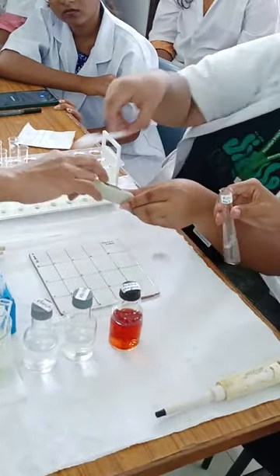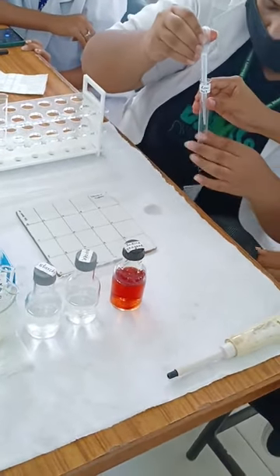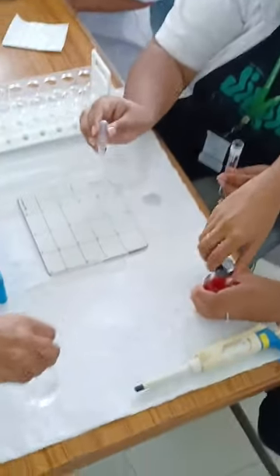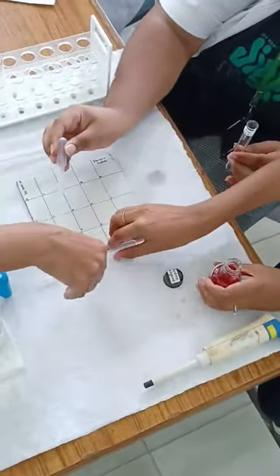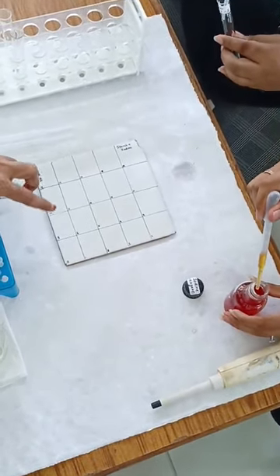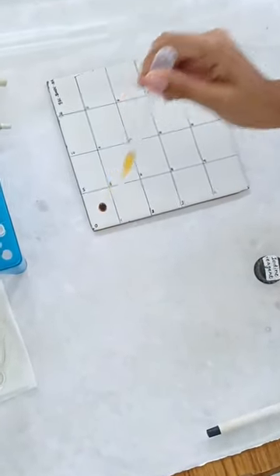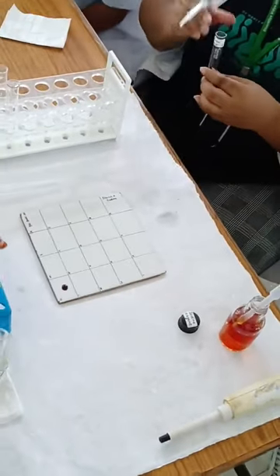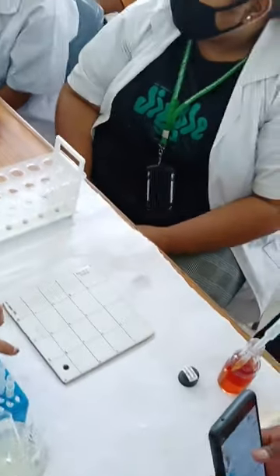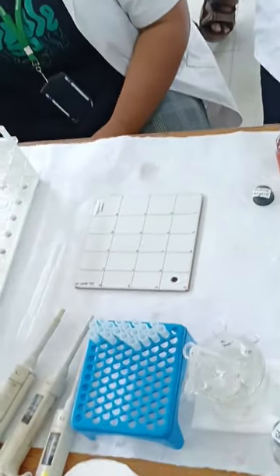Take one drop from the reaction mixture and check the 0-minute color. A drop is placed on the tile at the 0-minute mark and iodine is added to it — just a drop of iodine. You can note the change in color. It is very clear that at 0 minutes, the reaction mixture containing starch reacted with iodine shows formation of a purple color.